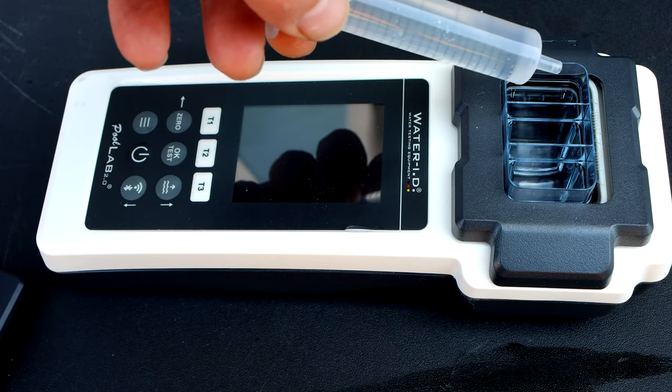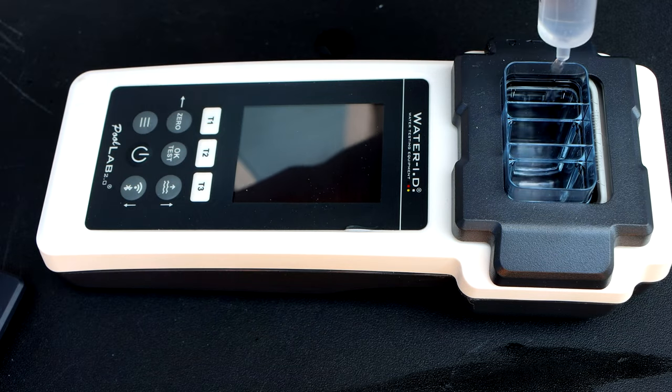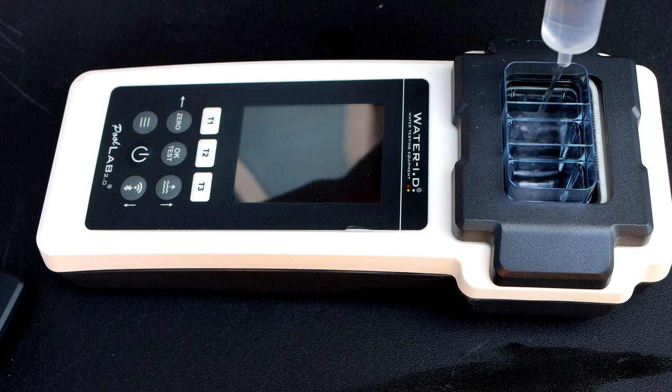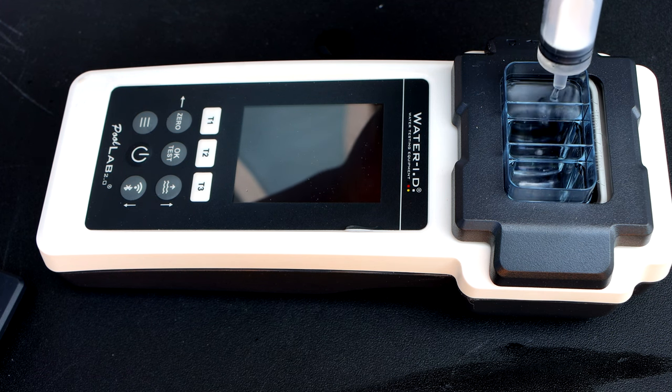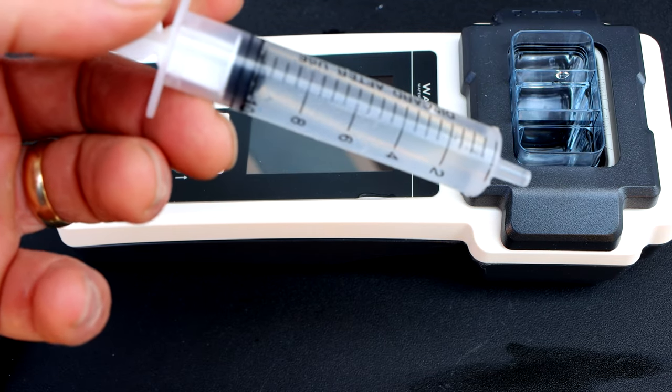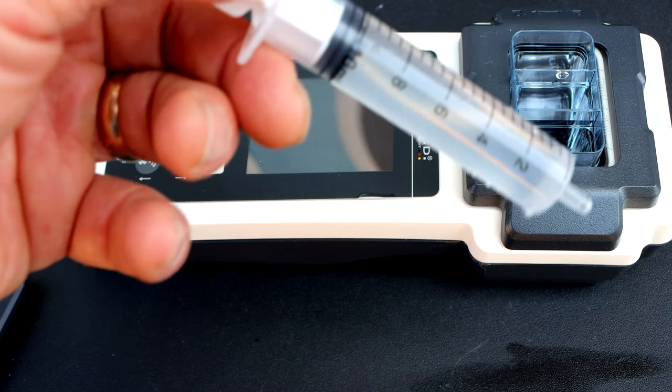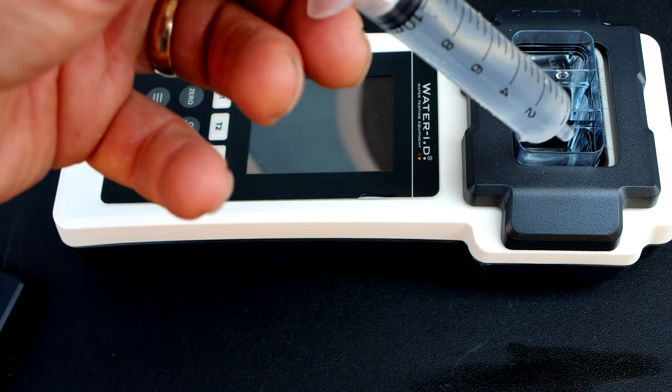I have my water sample here and you want to fill each chamber up to the 10 ml mark. You can see the syringe has a 10 ml mark here.